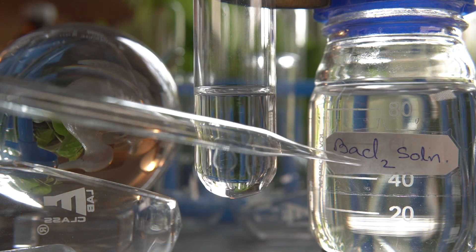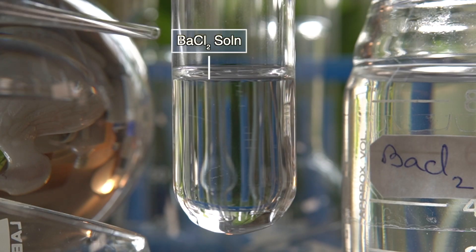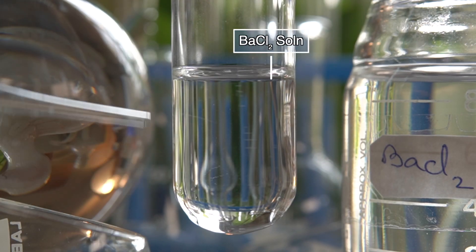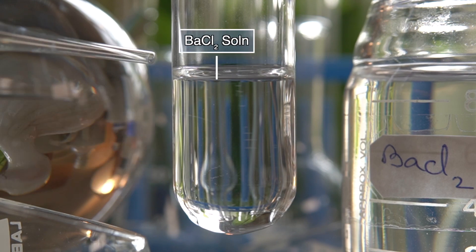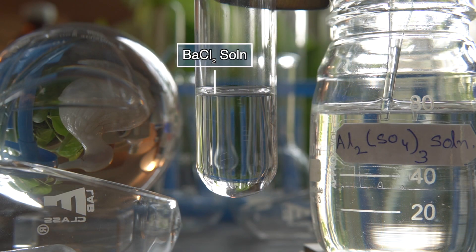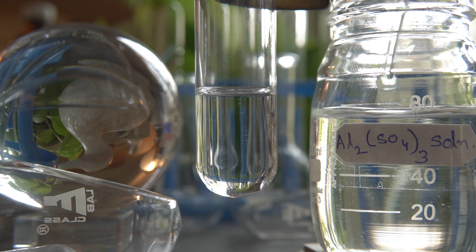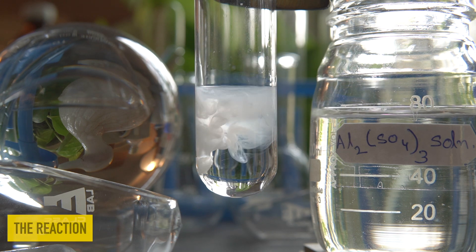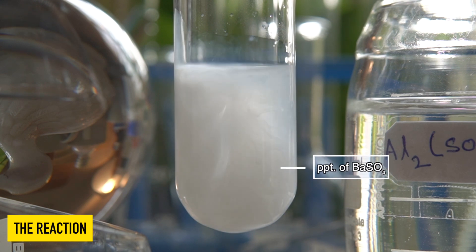To initiate the chemical reaction, we will take some amount of clear Barium Chloride solution into this test tube. Now we will add Aluminium Sulphate solution slowly into the Barium Chloride solution dropwise and observe the effects.